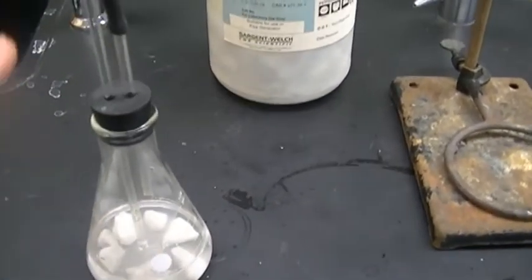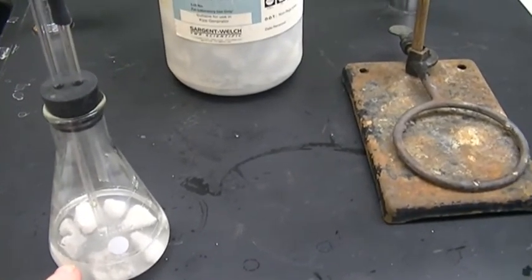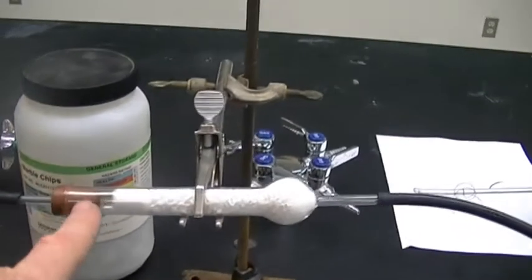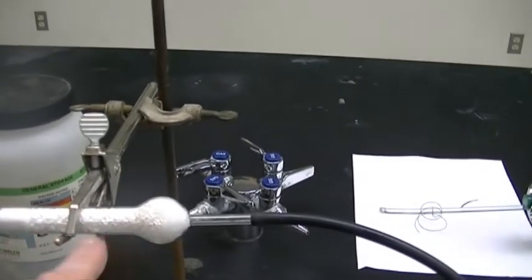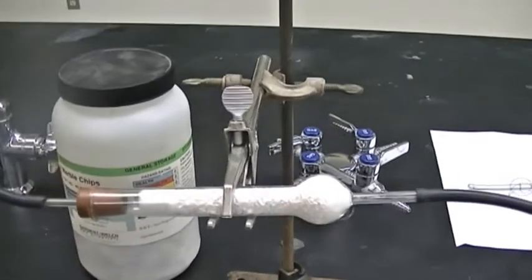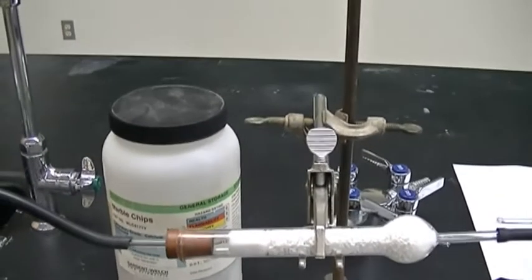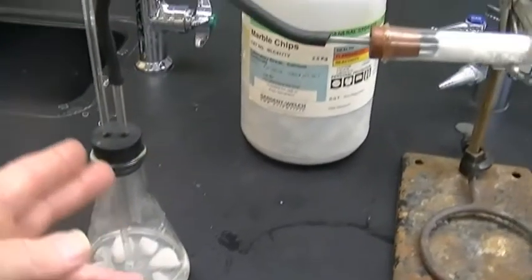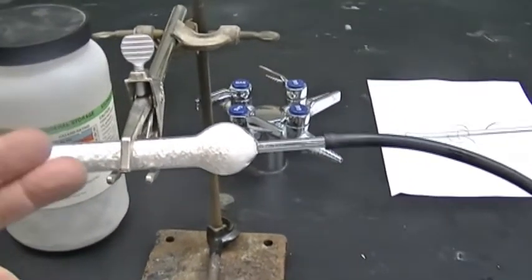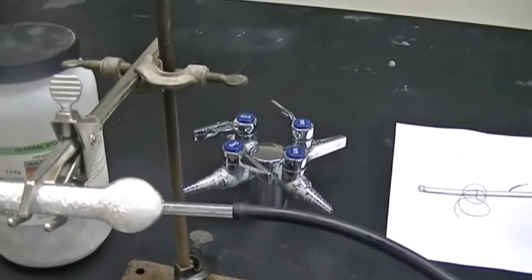And we have the glass tube that goes into the liquid. So when it produces the gas, it is going to go through this tube and through the drying tube. We have anhydrous calcium chloride in here. We have liquid water, and we are generating CO2. The reaction is exothermic. Water is a product, so we're going to have a lot of water vapor coming up through here as well. This is going to take out all of the water vapor, so the only thing coming out this end is going to be dry CO2. Dry meaning doesn't contain any water.